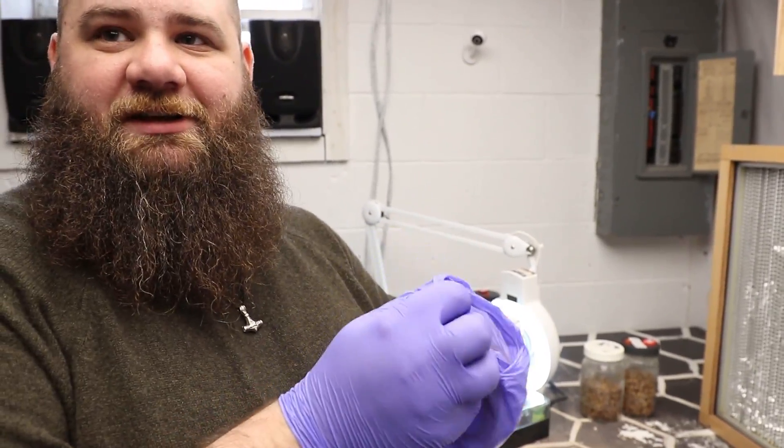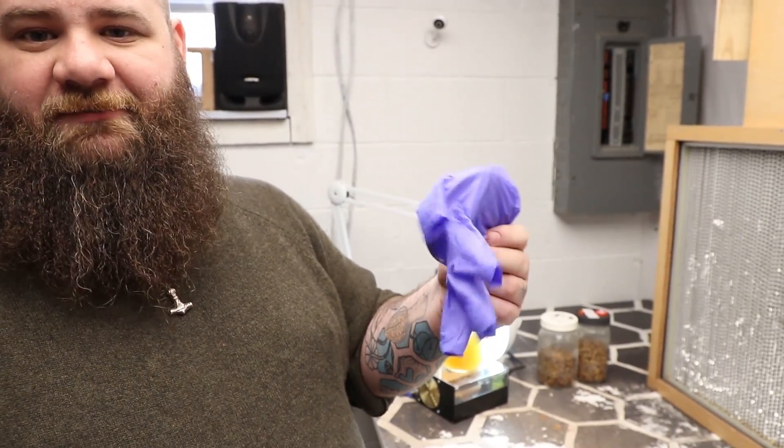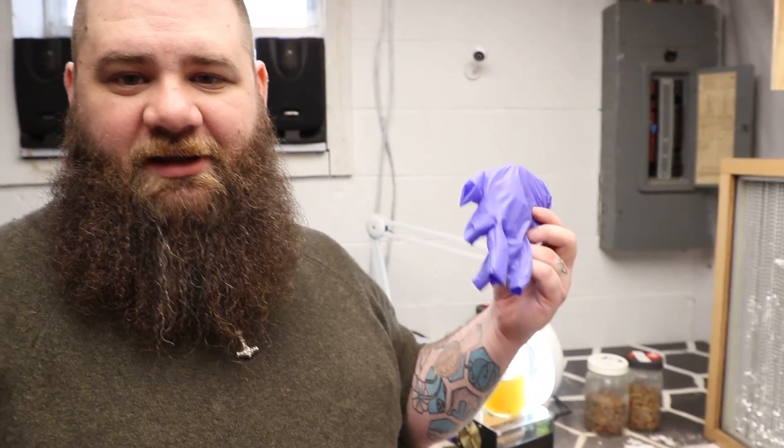When I'm cleaning up, I take that dish and instead of recovering it or Ziploc bagging it or just trashing it open, I cover it up first — that way if any mold or bacteria is growing in there, it's encapsulated in the trash. And now you should be able to manufacture your own grain masters.